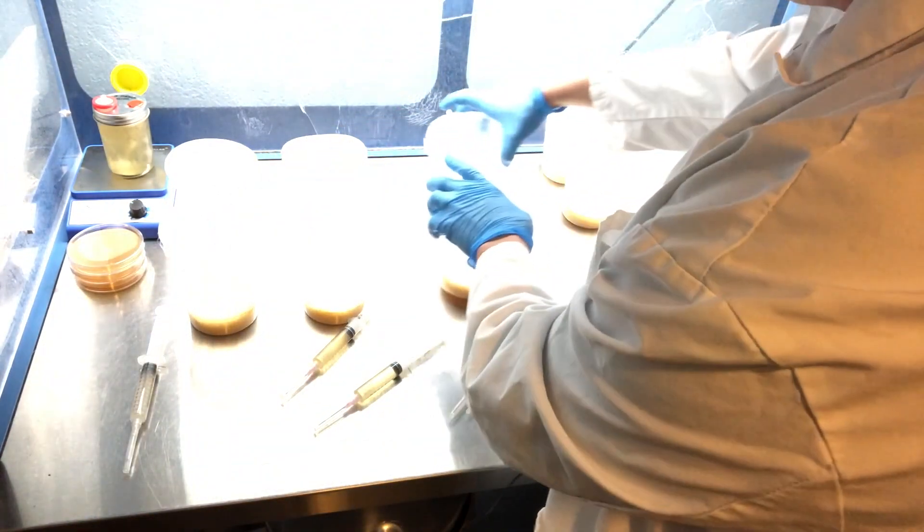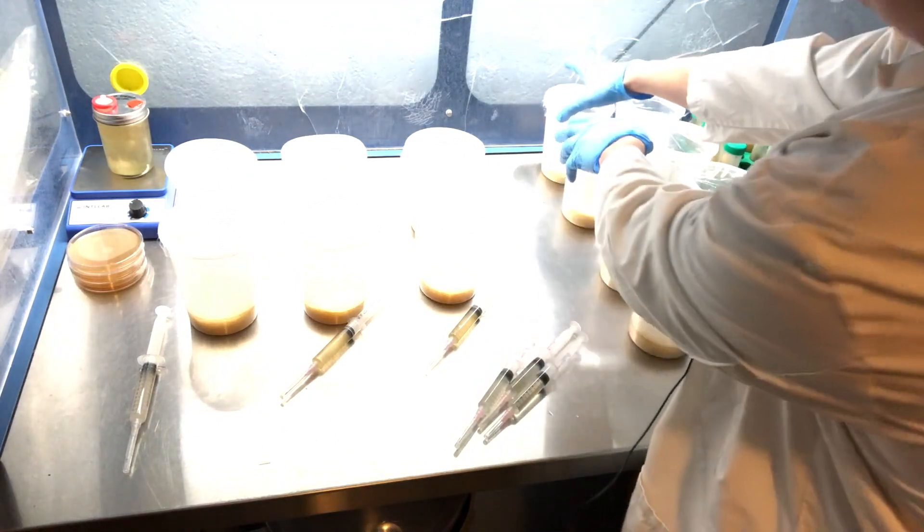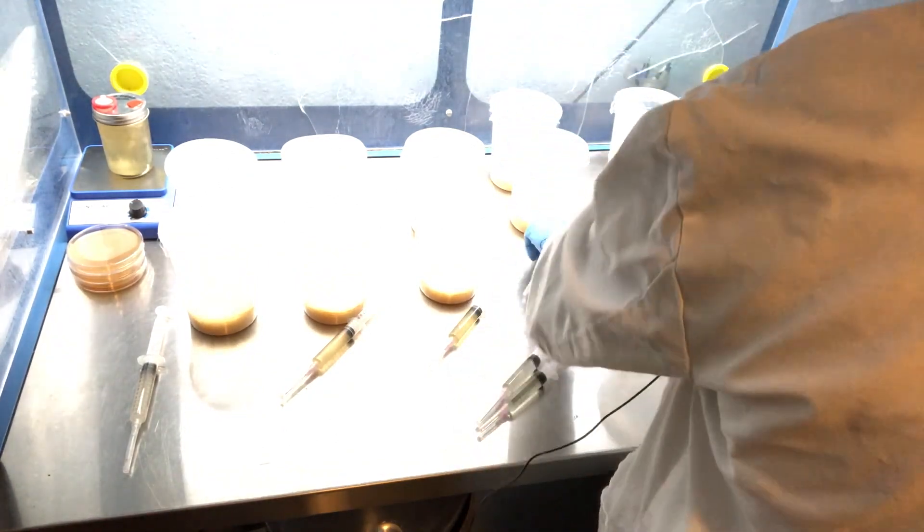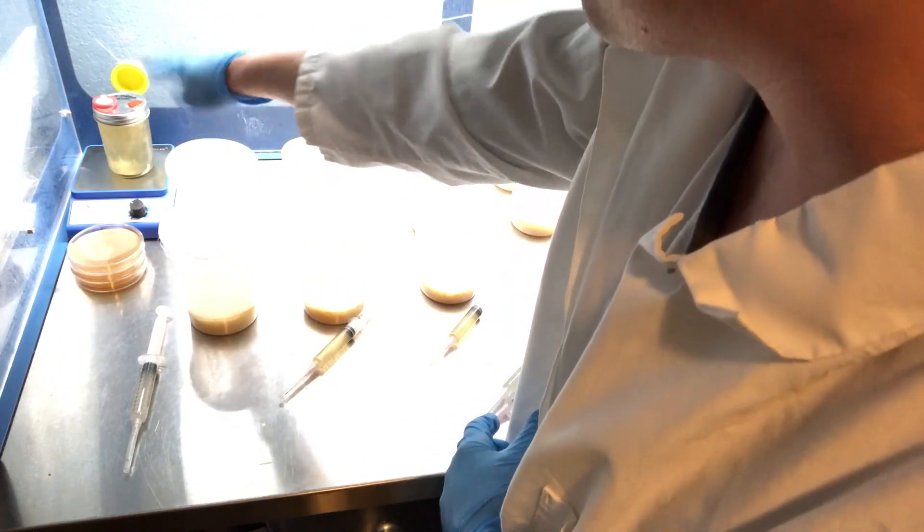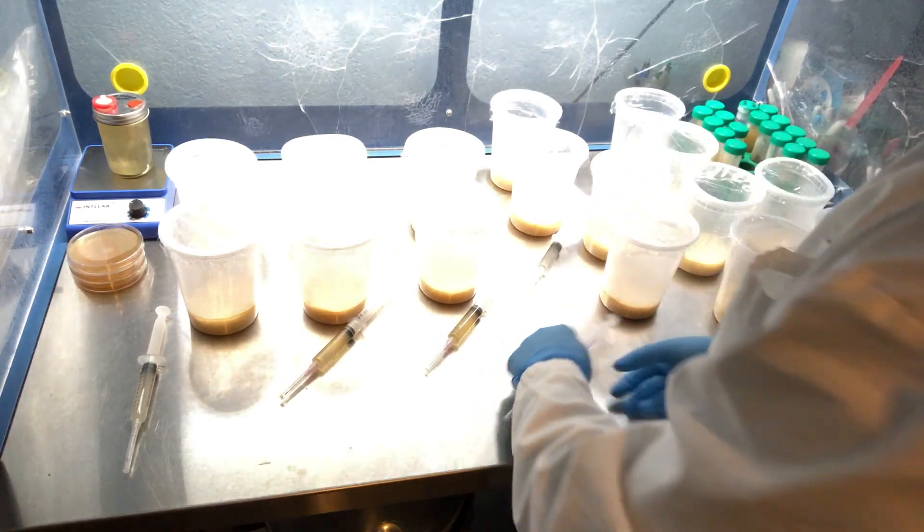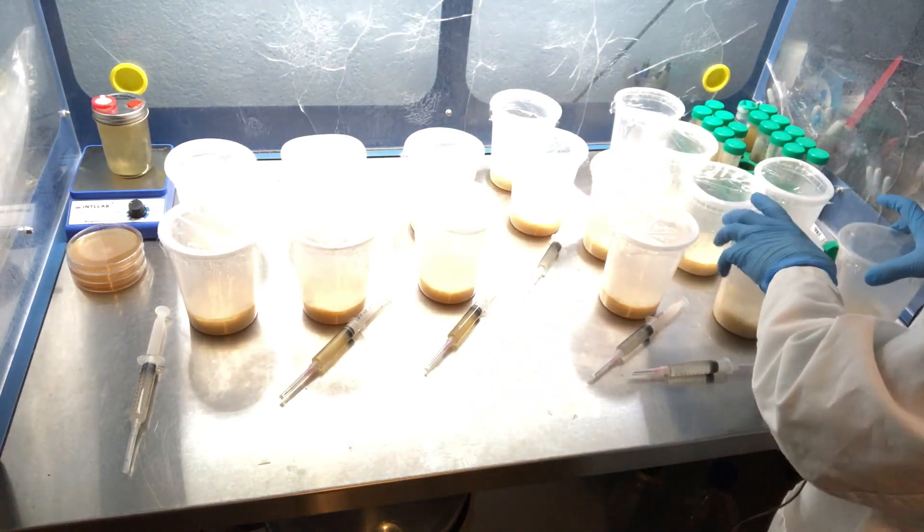I've got 16 of these prepared and I'm going to try to do about five milliliters per deli container. I've also got some Cordyceps that's spinning, that's the wild UK strain, just because I know that I don't have enough syringes prepared already.